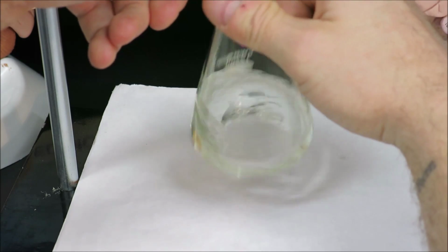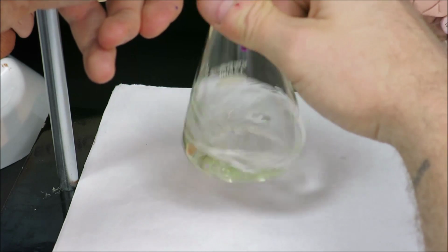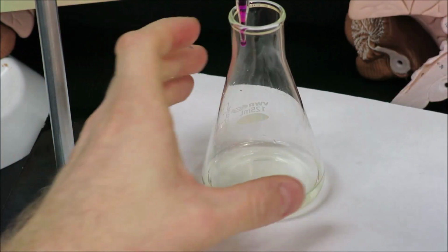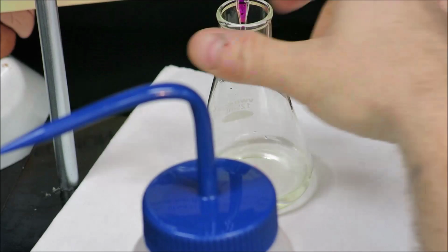It is sort of a difficult way to guess or predict here how much it will take. I suspect that maybe this last half drop could change the color. Now I can rinse that in with a little bit of water. So I see a small amount is hanging. That has to be counted as volume, so I'm going to rinse that in, and then I will swirl my flask.